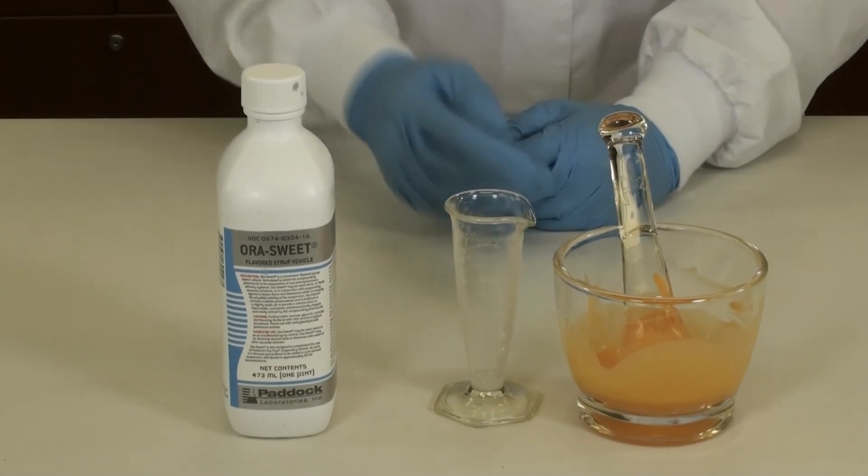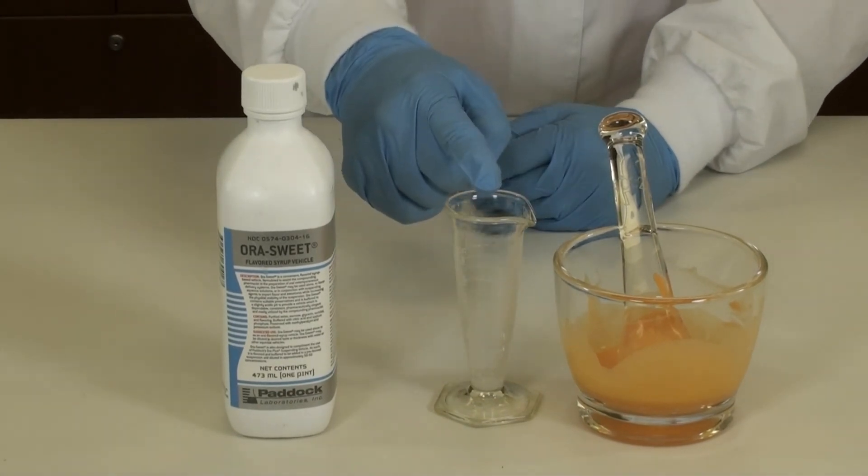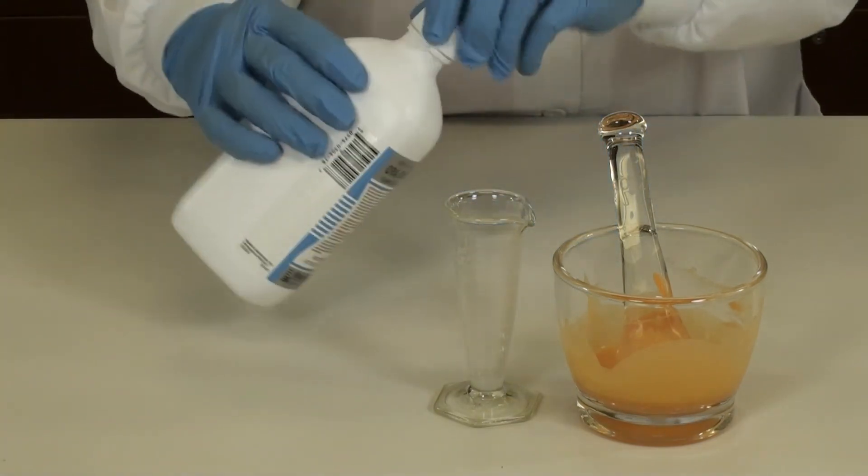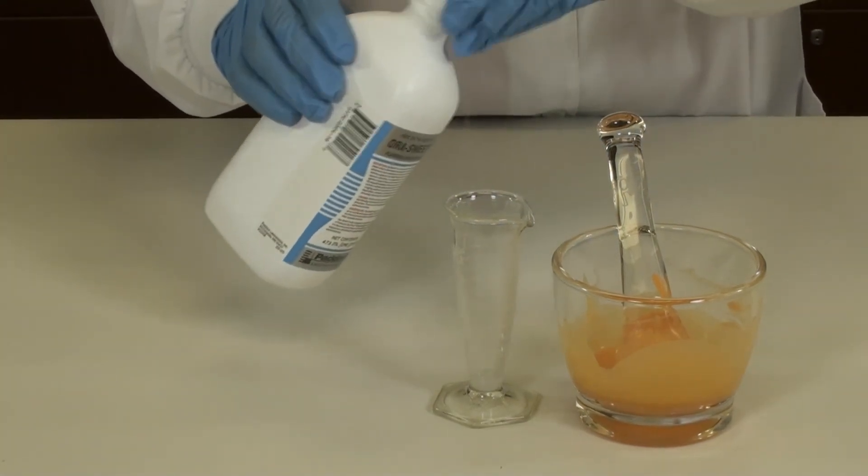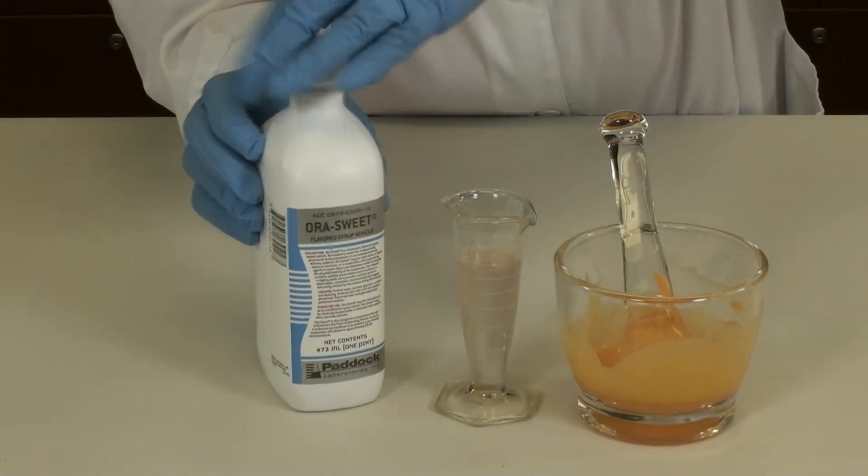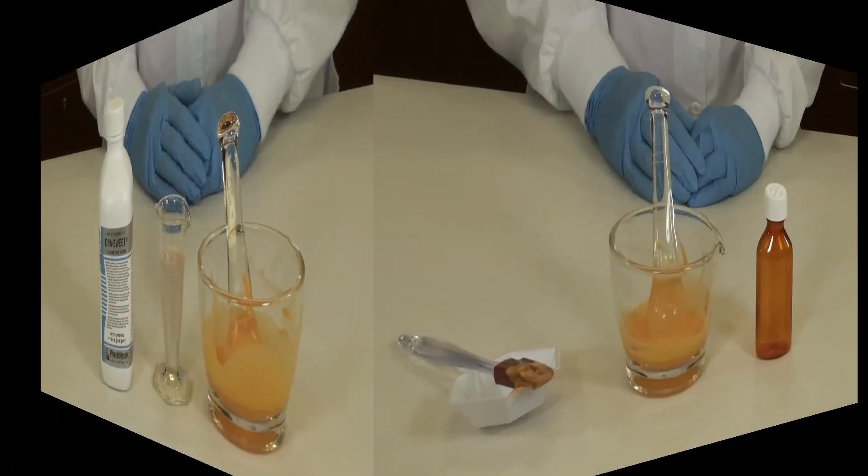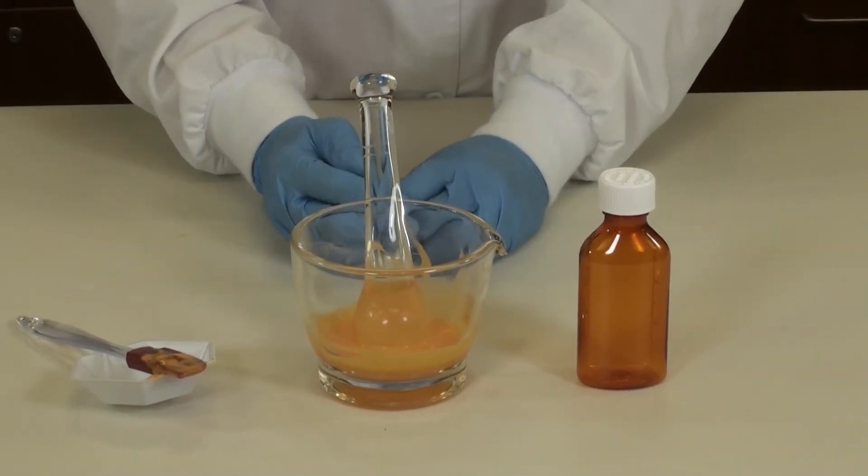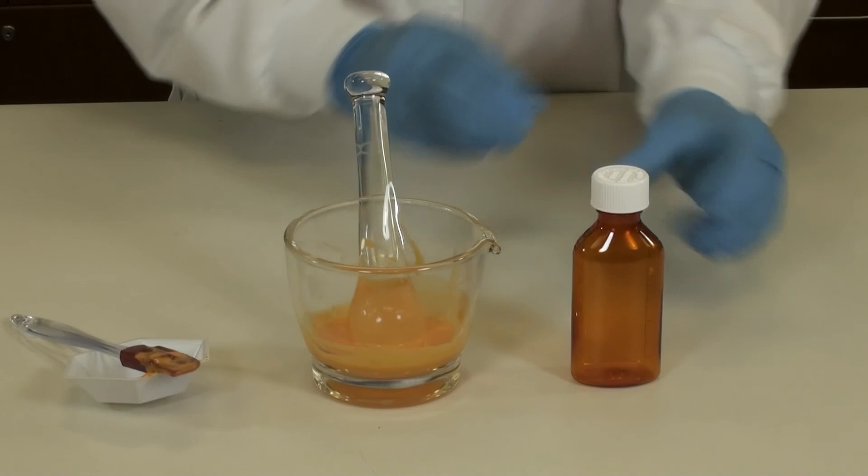You can now use the same graduated conical to measure your sweetening agent. Today we're using OraSweet. Pour the allopurinol hydrochlorothiazide and OraPlus into your prescription bottle.